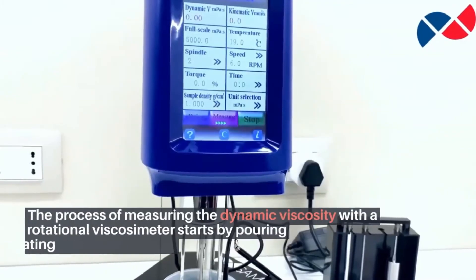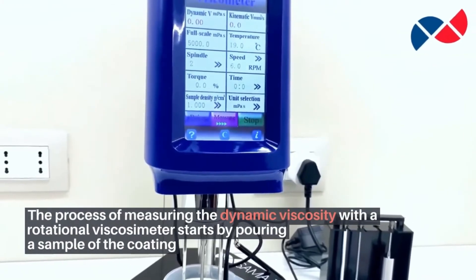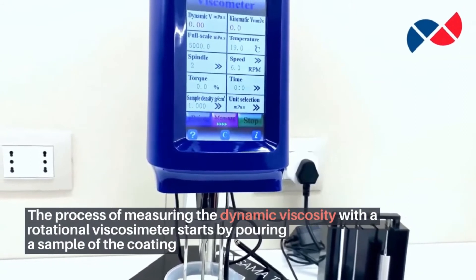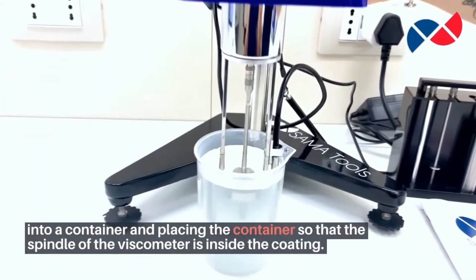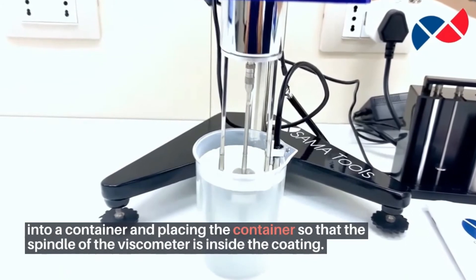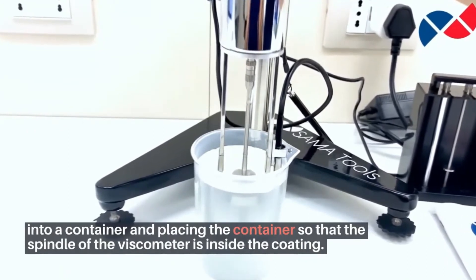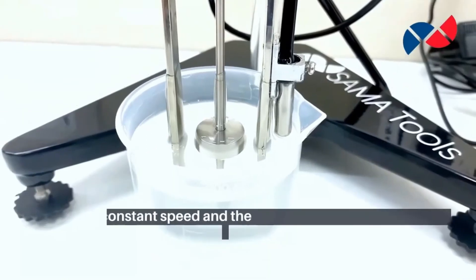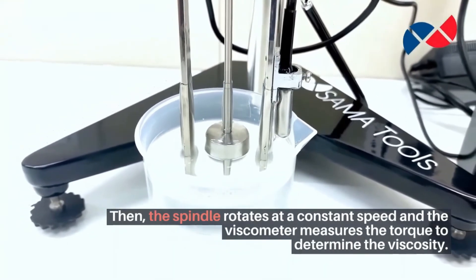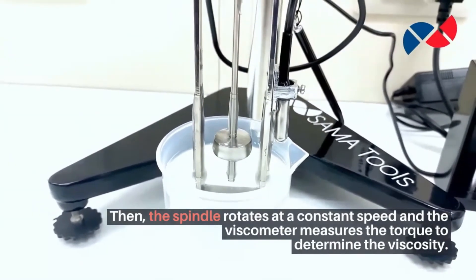The process of measuring the dynamic viscosity with a rotational viscometer starts by pouring a sample of the coating into a container and placing the container so that the spindle of the viscometer is inside the coating. Then, the spindle rotates at a constant speed and the viscometer measures the torque to determine the viscosity.